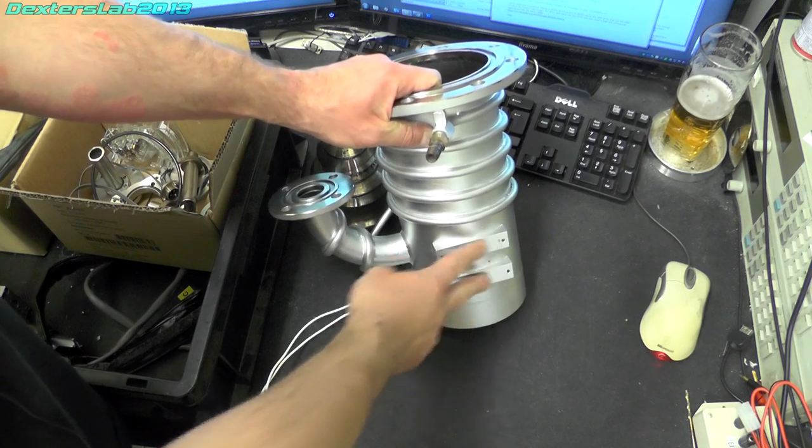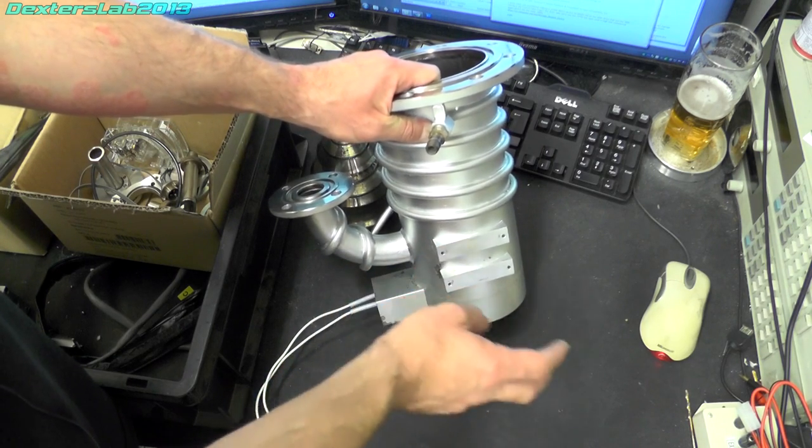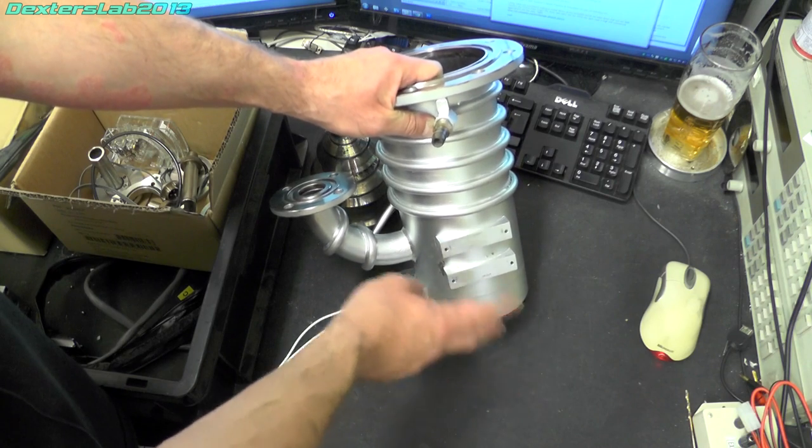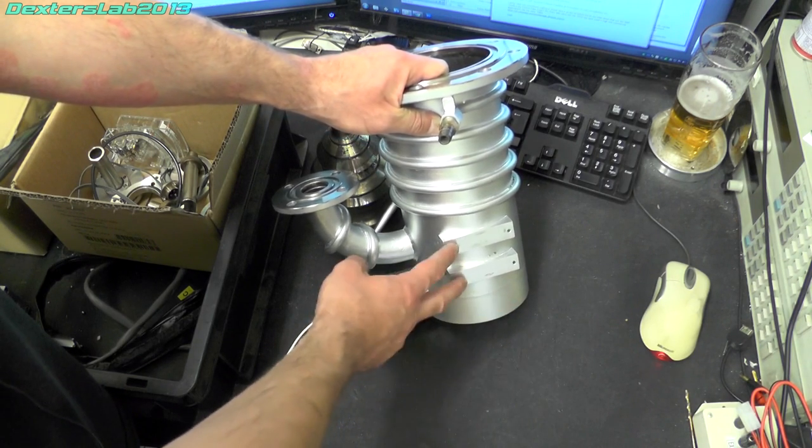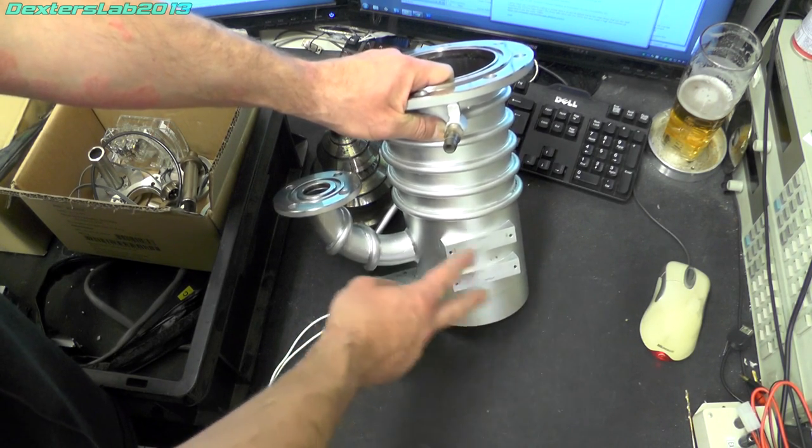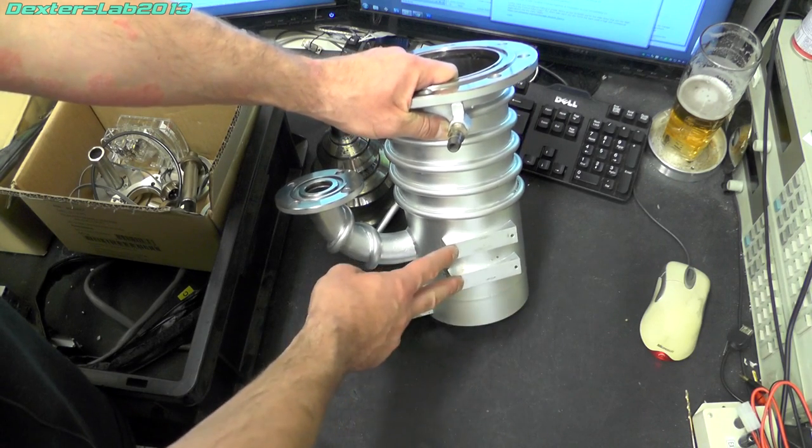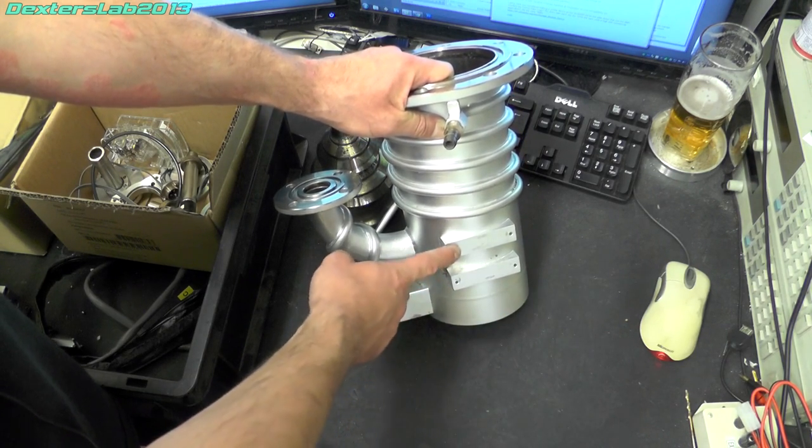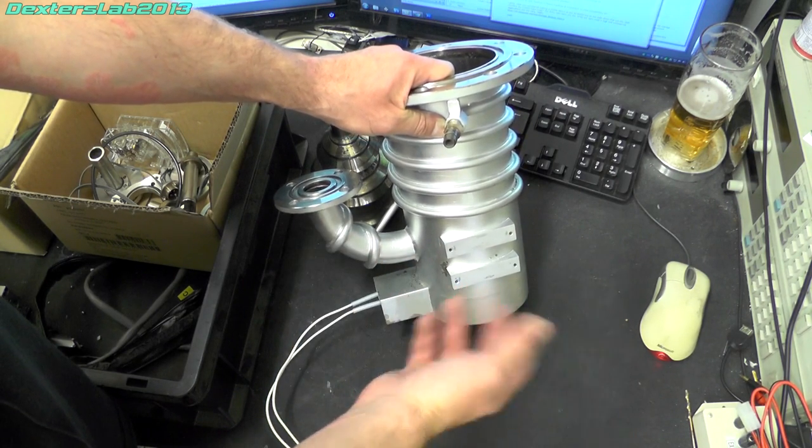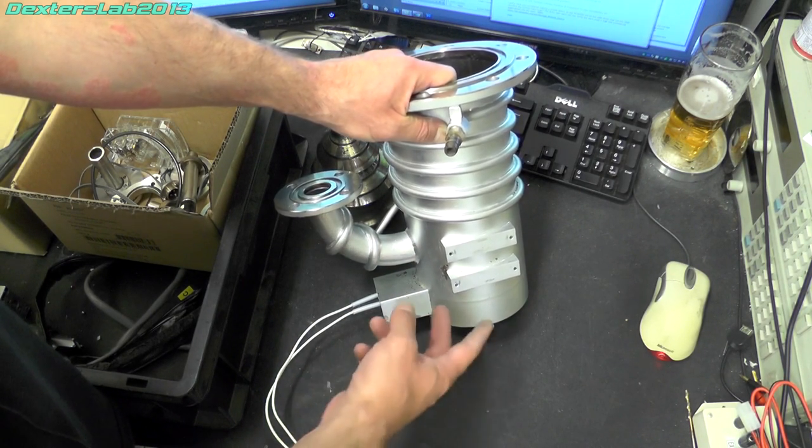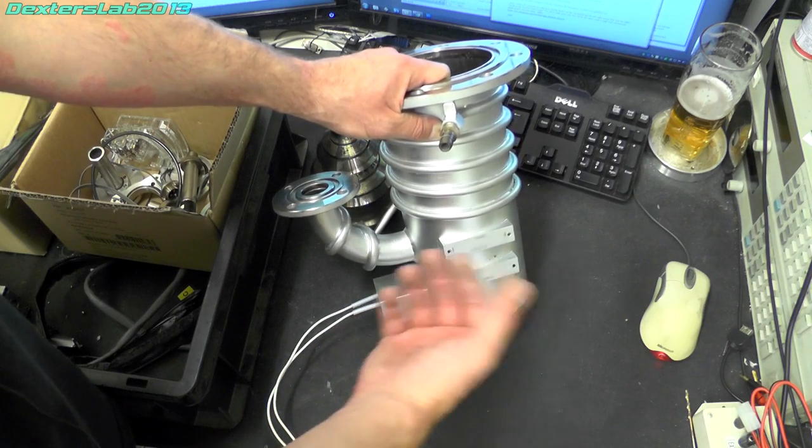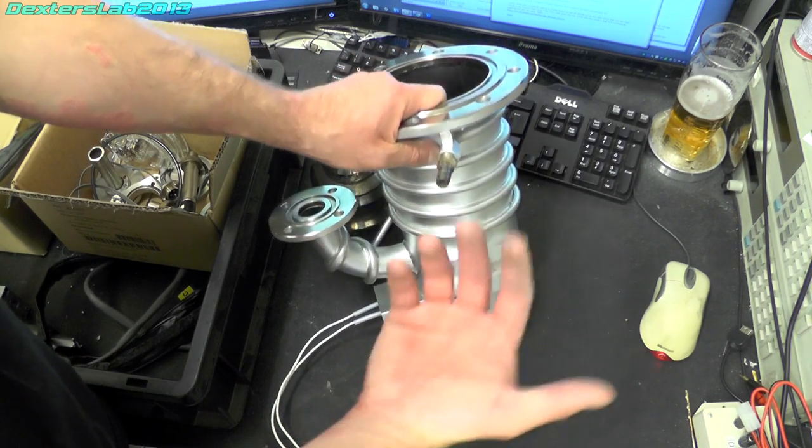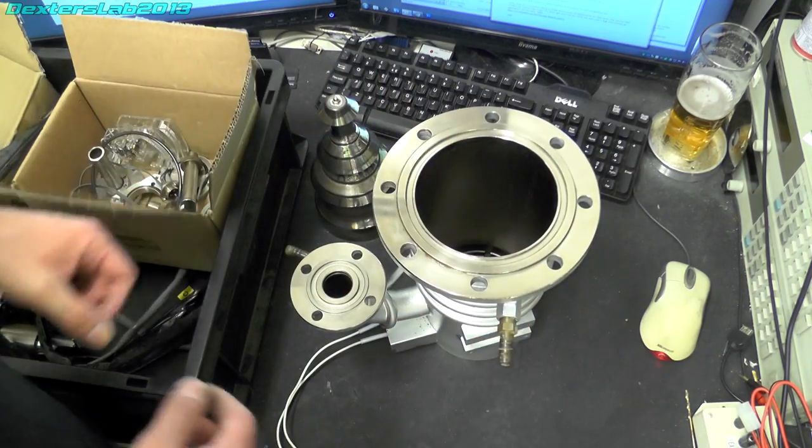Now attached to this just on these two spots here were two temperature sensors. They were really really simple bi-metallic strip sensors that just cut the power to the actual coils. I would imagine there were two. One was probably an overheat sensor so it literally cut out at a very high temperature. And then the other one would have been more of a thermostatic control for the heating element just to maintain it at a set temperature.